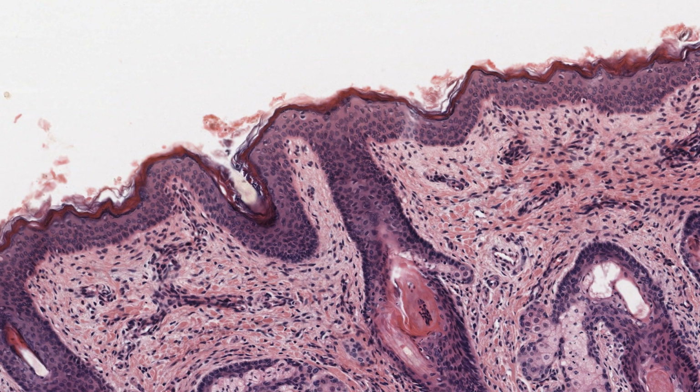The eosin dye stains mainly the proteins of cells. Two factors determine how much dye a particular cell will take up. One is the amount of protein in it, and the other is the solubility of the protein. Unless precautions are taken, a lot of the protein can leak out of the cells when tissues are fixed and stained. The proteins in keratin happen to be highly insoluble, and so it's almost always easy to tell whether a stratified squamous epithelium is keratinized or not.